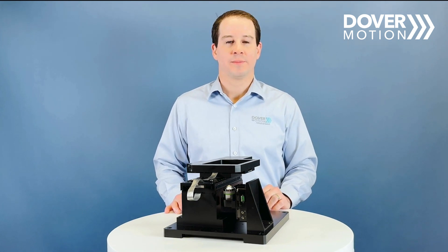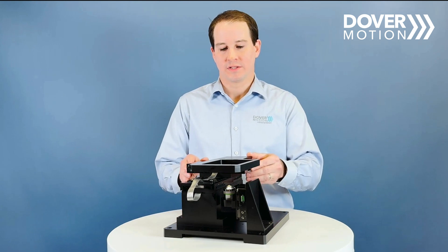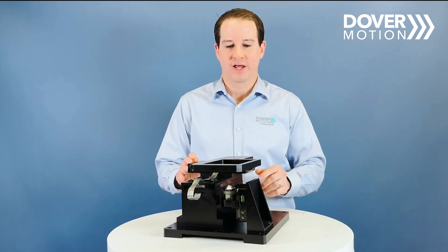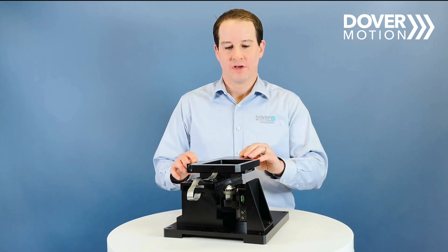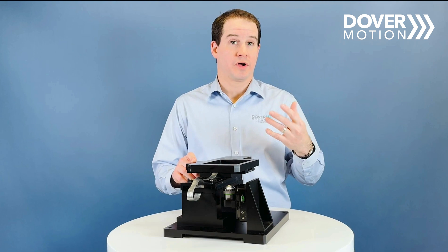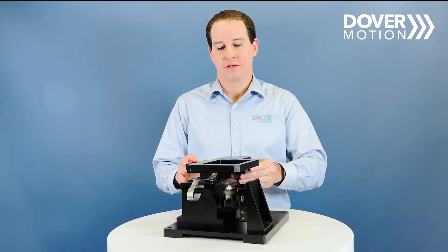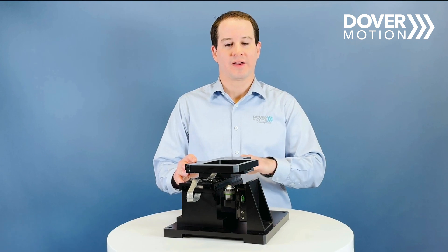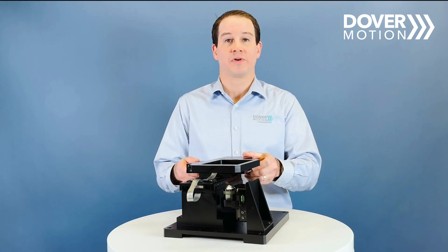In a typical microscopy application, the sample is moving. What we have here is sample motion XY separate from the DOF5Z stage. A well plate would go right here in the middle. You could also put a four-slide holder there as well. The typical application is to do your large moves with the lower axis and your very precise, very short moves with your upper axis.